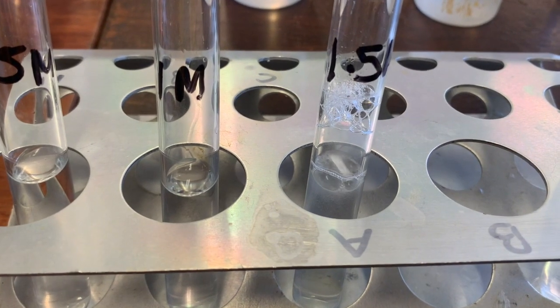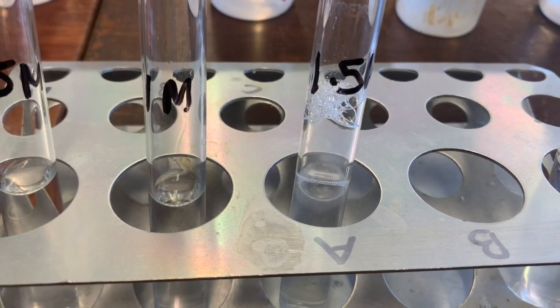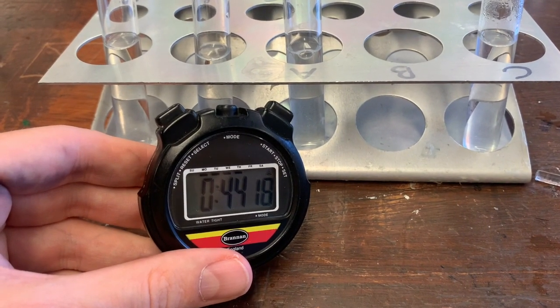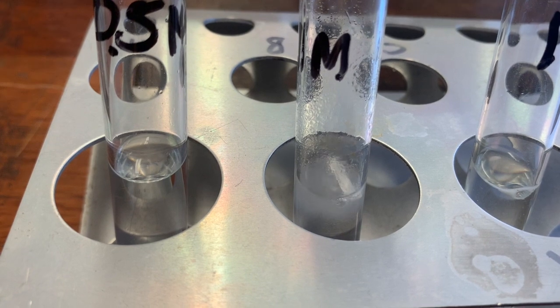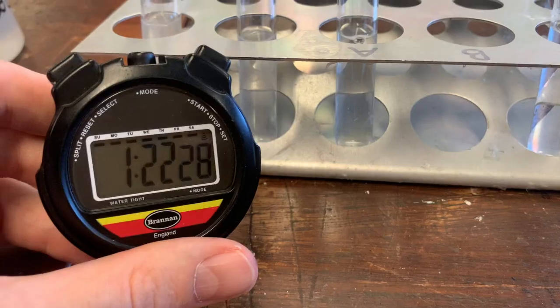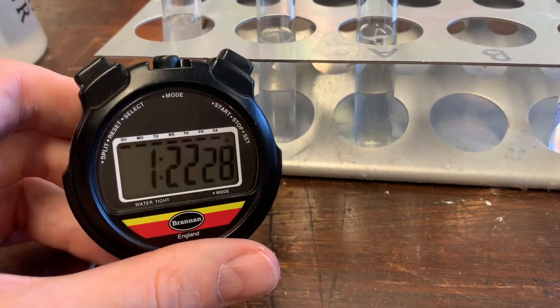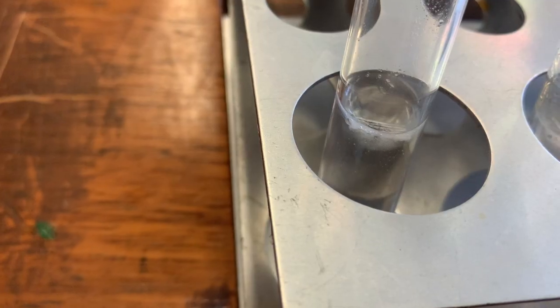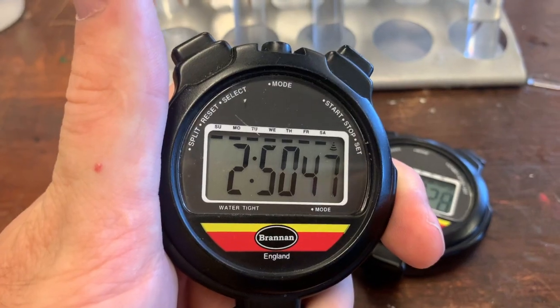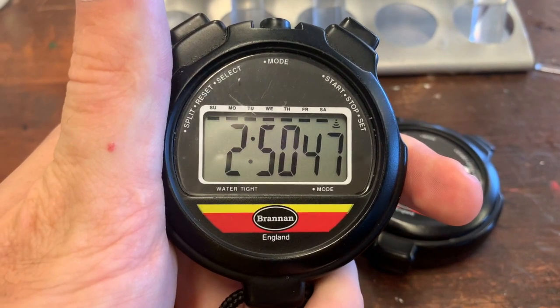The 1.5 molar is bubbling less vigorously, but still a lot more than the 1 molar was, and this one took 44 seconds. Even less vigorous bubbling from the 1 molar, which took 82 seconds. And the 0.5 molar is bubbling very slowly — lastly, the 0.5 molar took 2 minutes and 50 seconds.